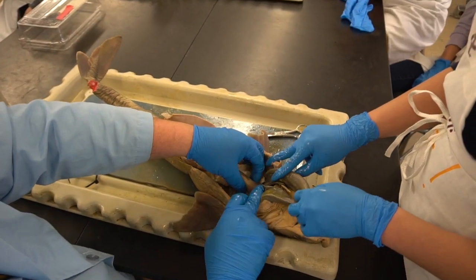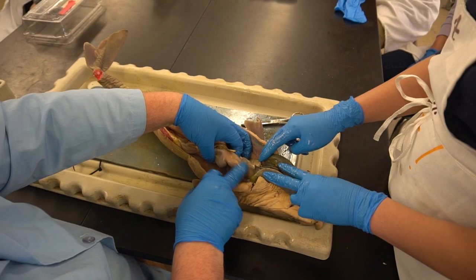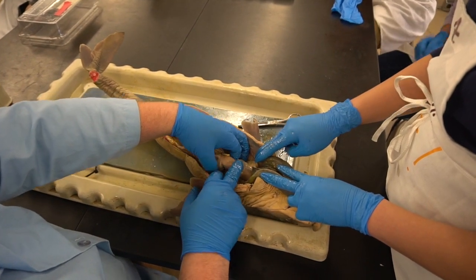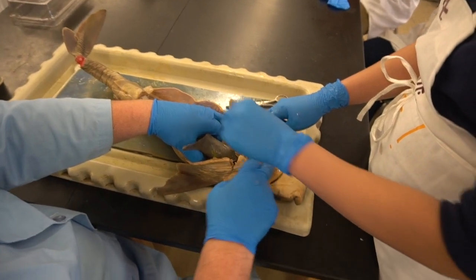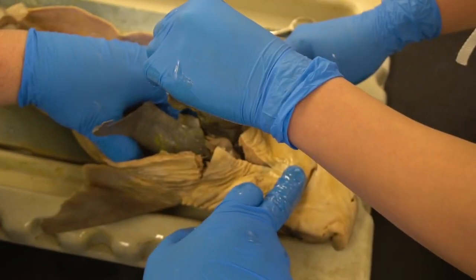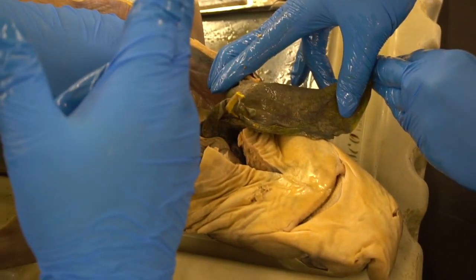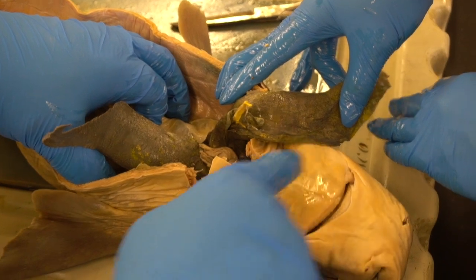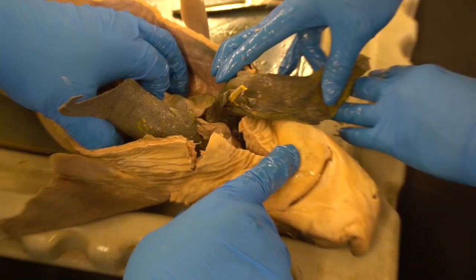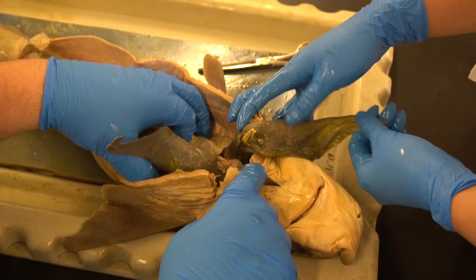If I push back on the liver, I see a pretty muscular structure here. This is the stomach. Okay? Later on we can make an incision and continue this all the way up to the mouth, and if you care to, you could sacrifice the jaw, cut the jaw in half at the middle, push that apart, and then you can see the evidence of the pharynx or the throat area, and it traveling into the esophagus.